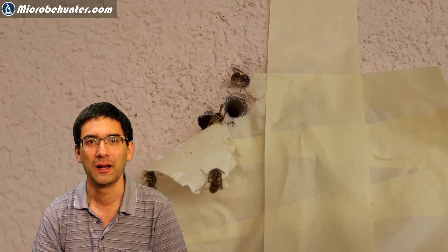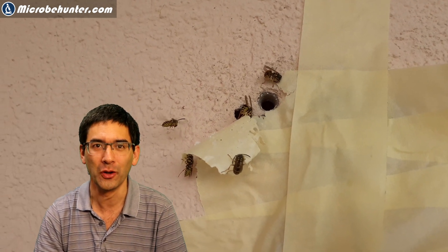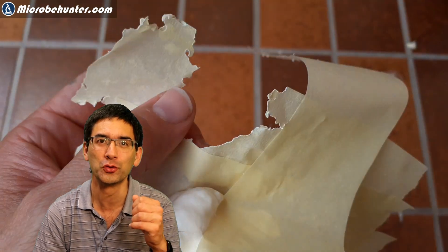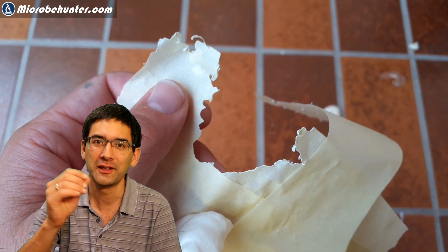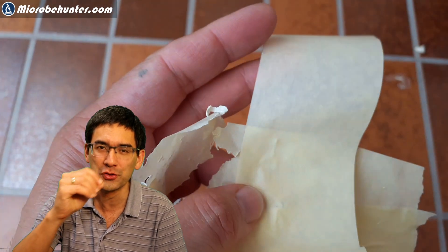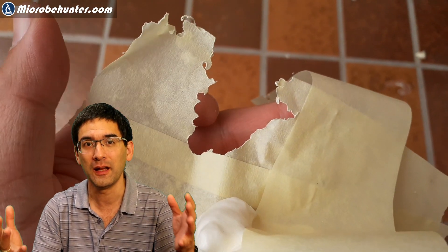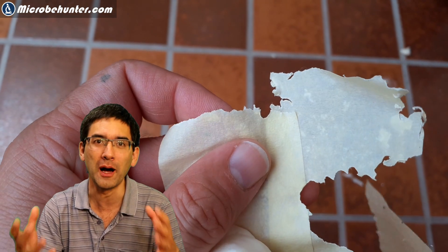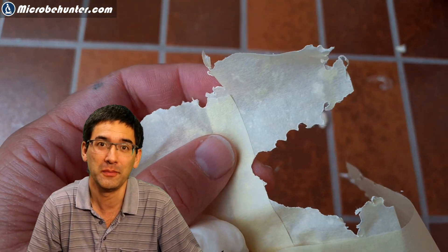I'm going to show you now how I'm going to catch the wasps because all you need is a cup and a little bit of alcohol. So what I have done is I put some tape over the holes to prevent the wasps from entering and leaving the nest. Unfortunately, it didn't work quite well because the wasps started to remove the tape. You can see here that it actually cut away those round sections of tape. They have done this using their powerful jaws and basically it was totally pointless and it was absolutely without effect.